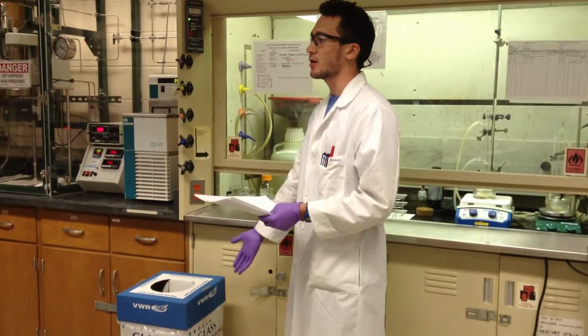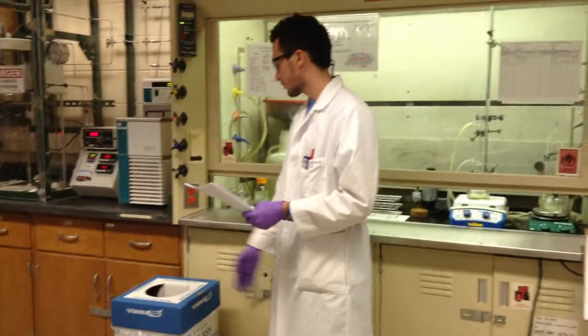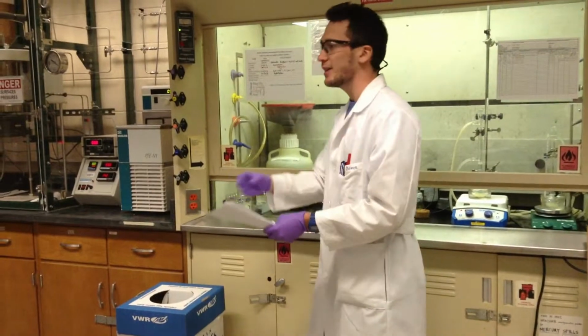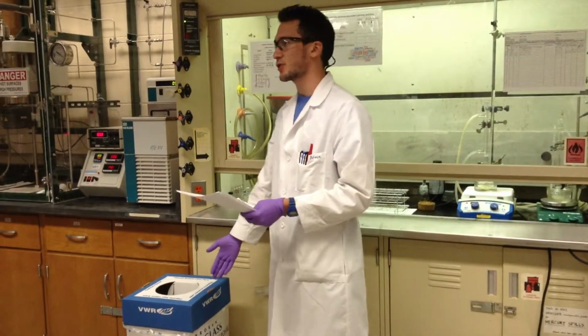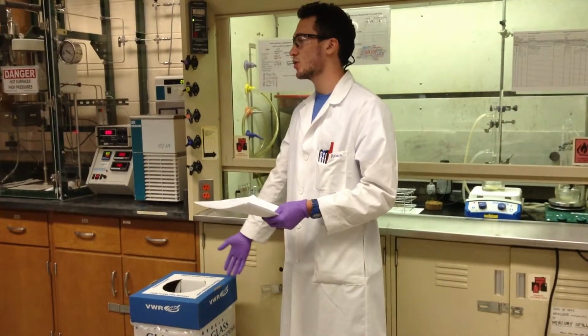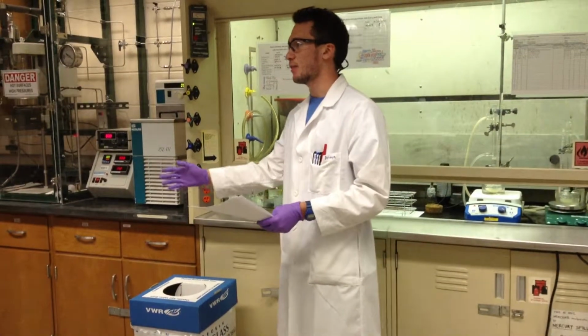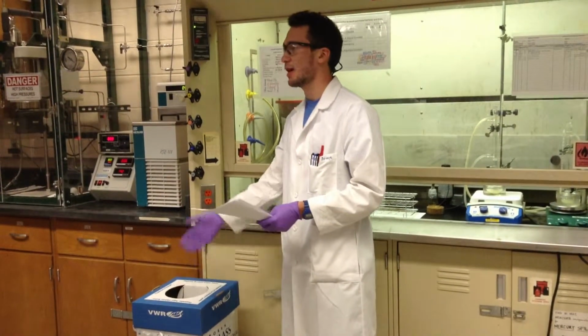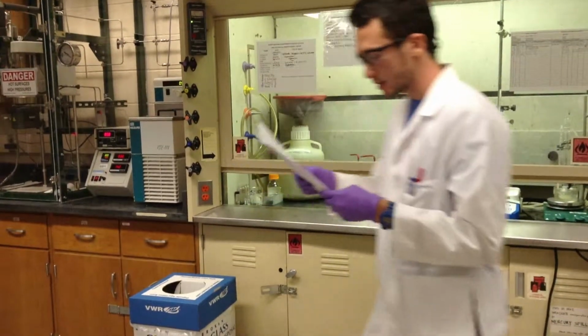Do not throw chemicals into the broken glass trash. If you have the lids of the vials, it's okay if they go in there, because this is not going to be recycled because it has dangerous chemicals, so they just go to the trash anyway. But just limit glass and maybe some lids. It's okay, but do not dump any chemicals in there.